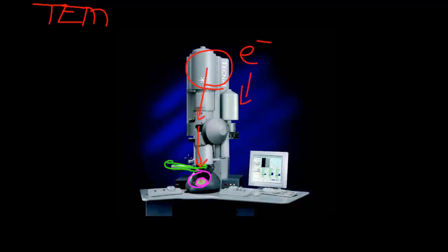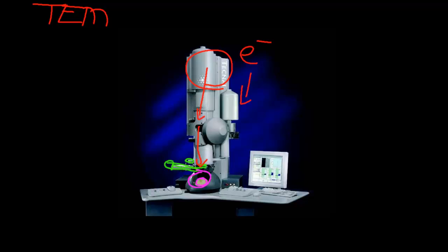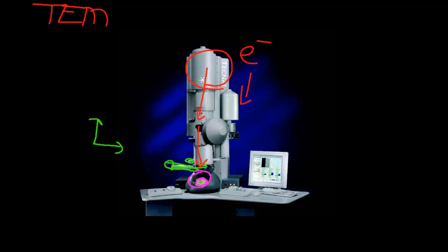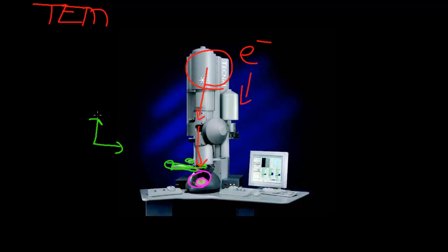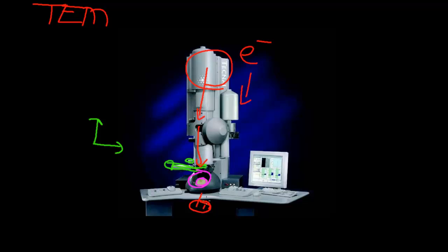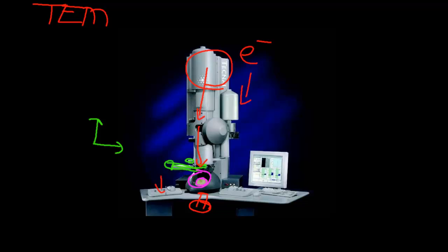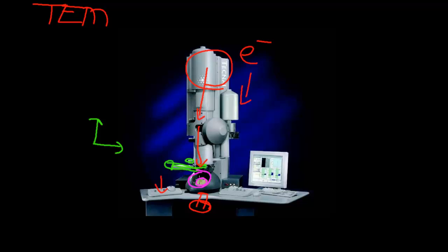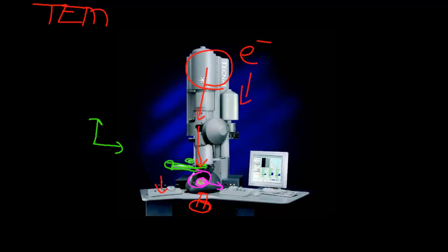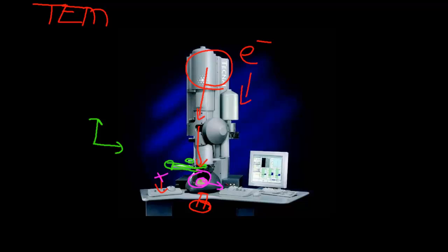The various handles that you can see around it, and on the end here, allow you to move the specimen on an XY plane — left and right — so you can move around to find the right area that you want. Underneath here, sitting under here, is usually a camera with the lens pointed upwards. This equipment here controls the camera. You can move the screen out of the way with a little lever, and then take photographs to end up with an image of the specimen.